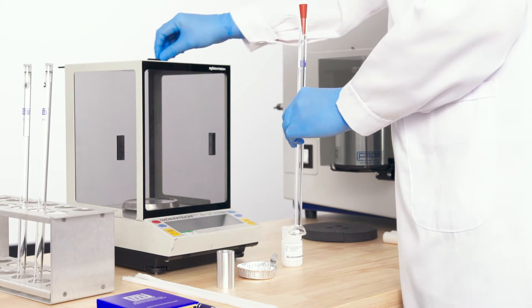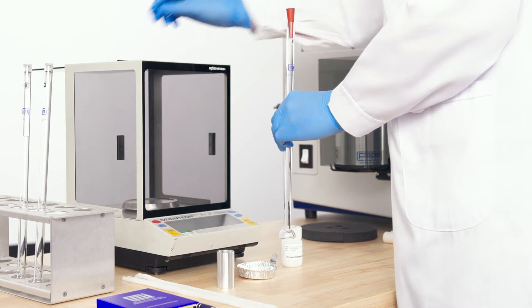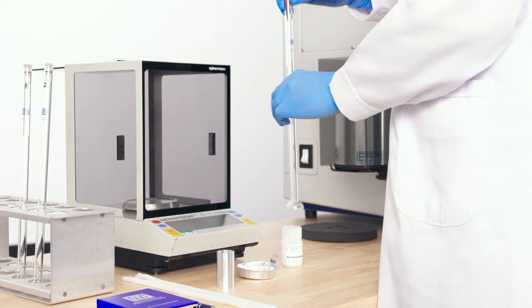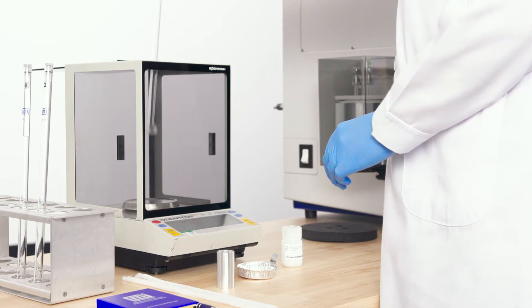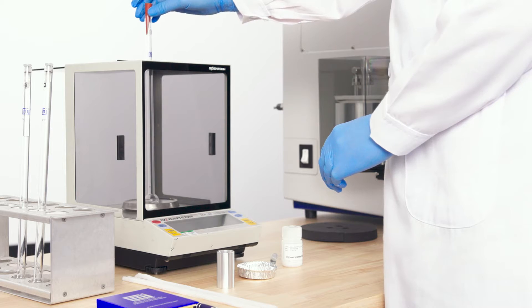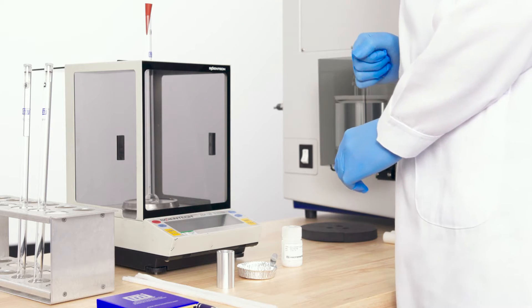Weigh the empty tube with a rubber stopper. Use your good lab practices to determine the mass and record.